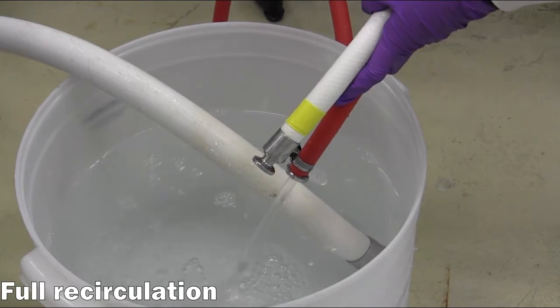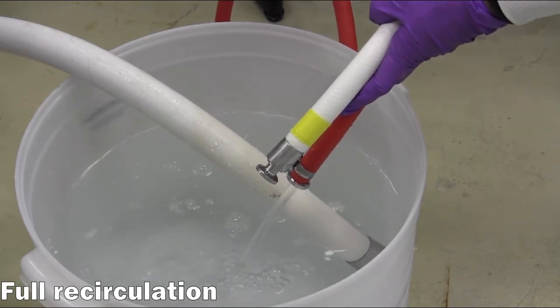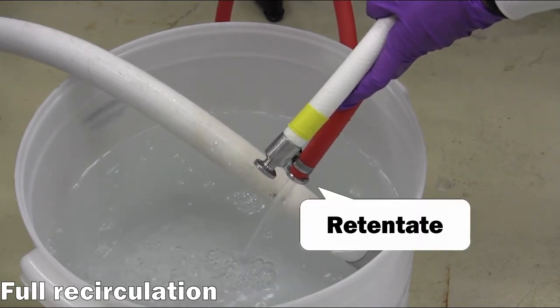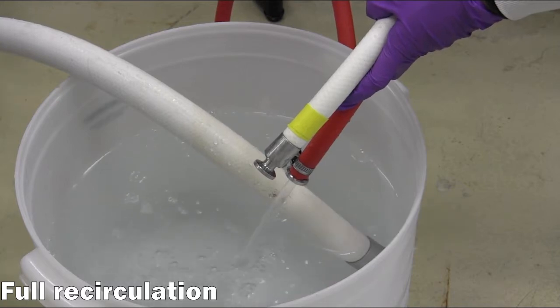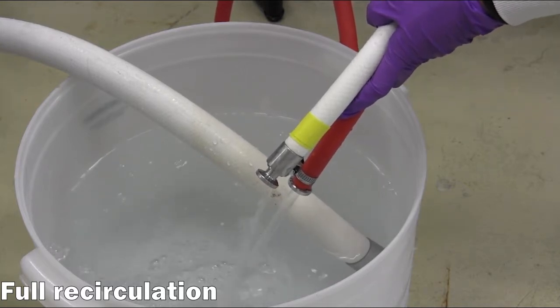Continue to monitor the streams as the system runs in full recirculation mode for at least 10 minutes, to ensure that there are no leaks and that the system is fully primed with liquid.